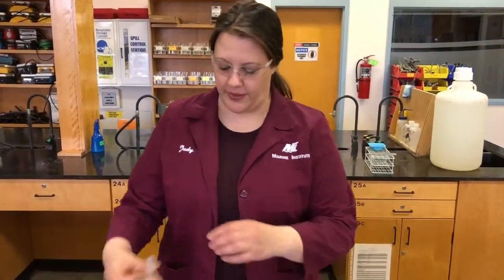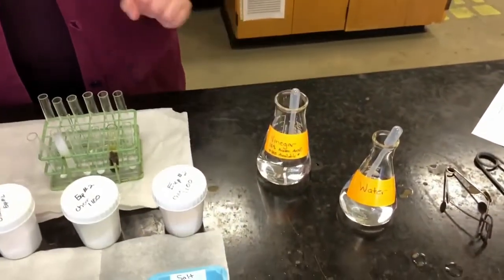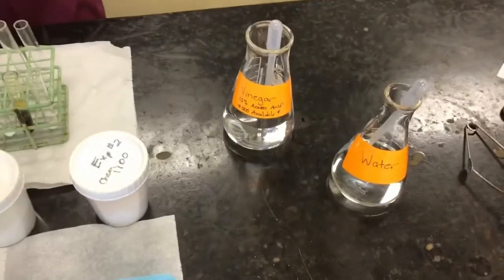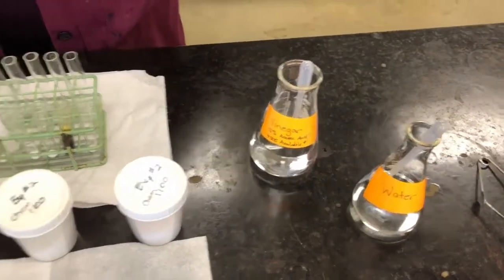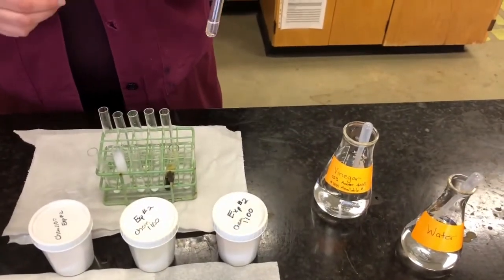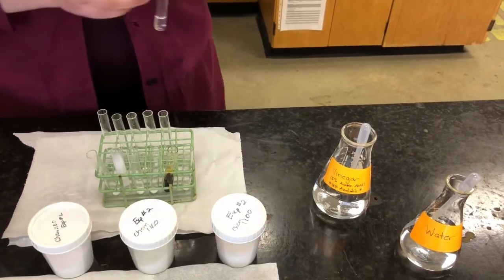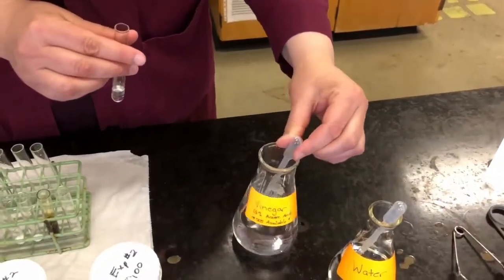So the next property we're going to look at is the effect of adding an acid. And our acid in this case is going to be vinegar, which is 5% acetic acid. Okay, so we're going to add vinegar to the solutions. And I can actually add the vinegar to the same substances that I already put water in, because water won't have any effect on whether or not it reacts with the vinegar. Okay, so I'm going to take my pipette again and add some vinegar.